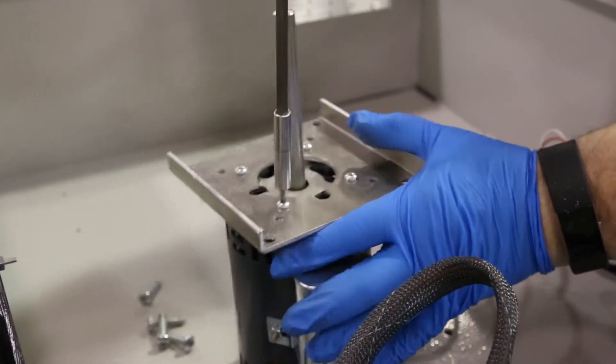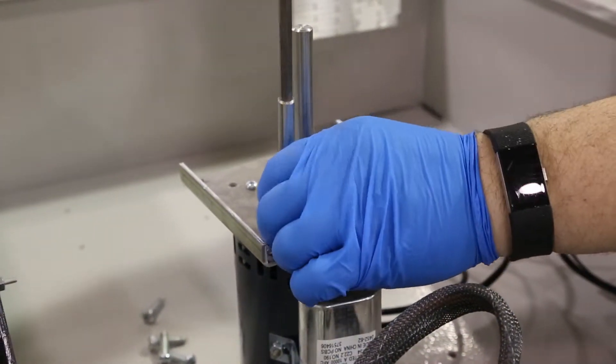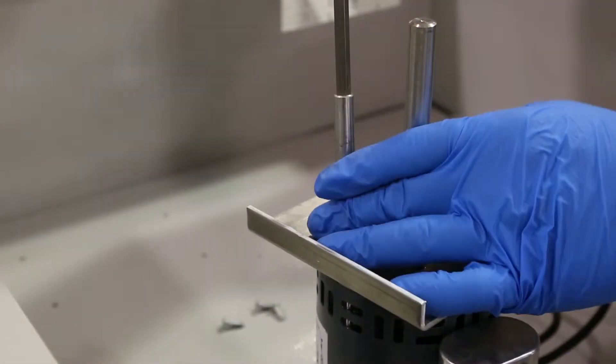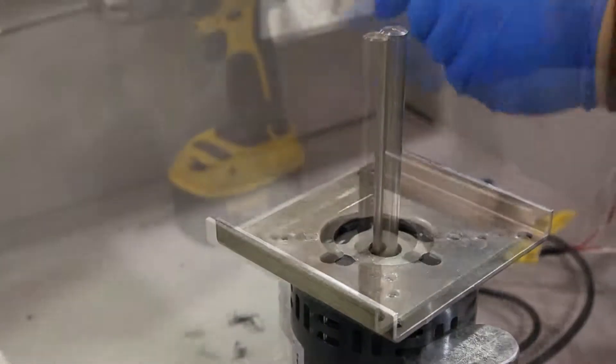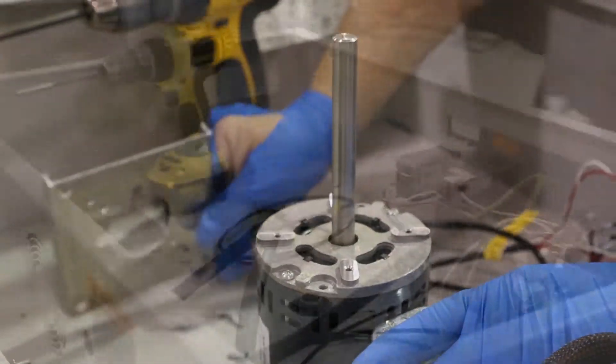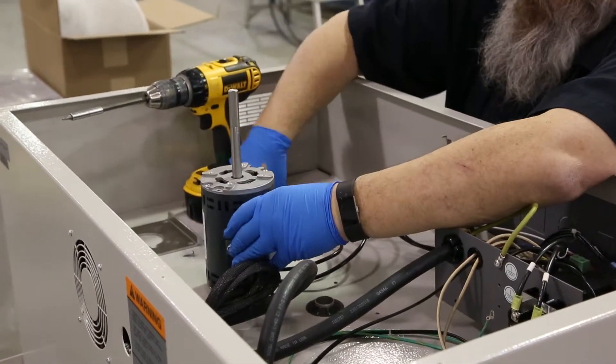Remove the base plate with a T20 driver. Attach the base plate to the new motor.